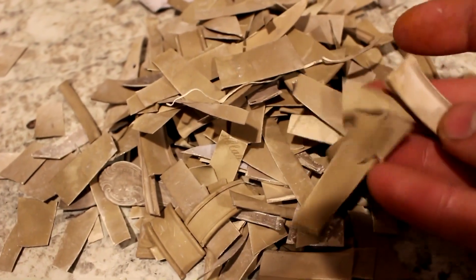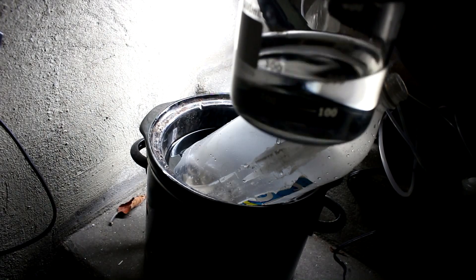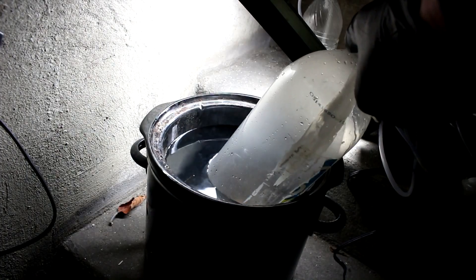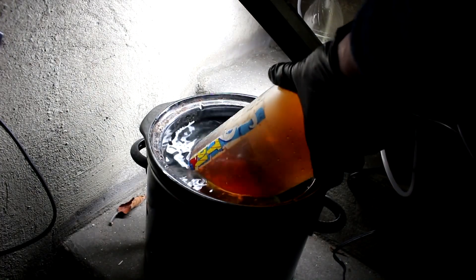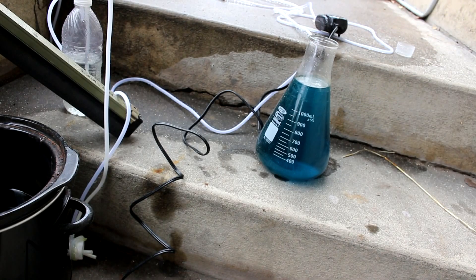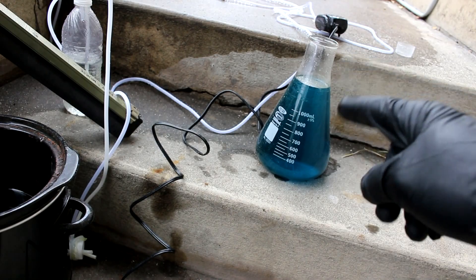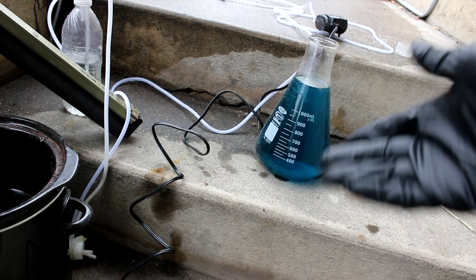I've cut the pieces into slightly smaller sizes to fit inside a 2-liter bottle. Here's 200 mL of 50% water and 50% nitric acid — I'm going to add it in increments until the silver is gone. This is reacting nicely — maybe actually too fast, so I'll put it in a cooling bath. All of the remaining silver is now dissolved with nitric acid. I've got over a liter of silver nitrate solution with quite a bit of copper in it. I used about 500 more mL of nitric acid, bringing my total to about 800 mL — which is what I had anticipated to begin with.